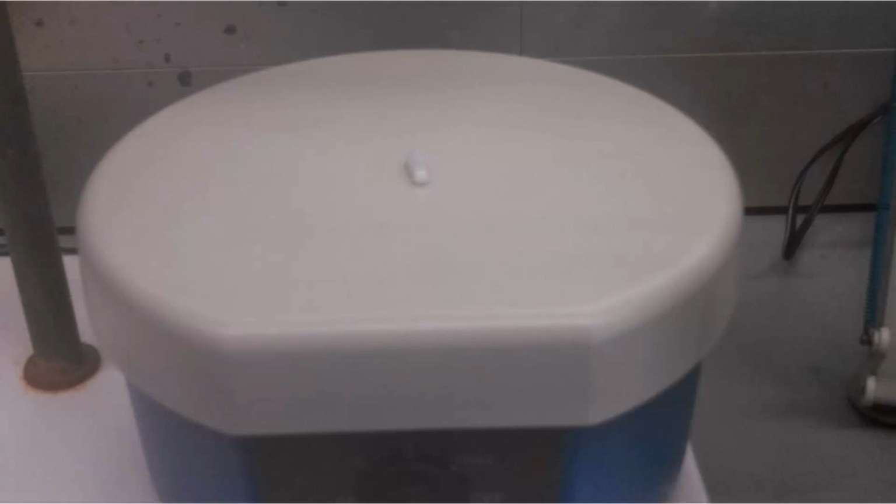Like I said, this stir bar is really tiny. All the waste for this experiment can go down the sink, but it's very important that you don't dump these stir bars down the sink because they are obviously not soluble in water. If you'll notice our sinks, all the drains are on the right-hand side. So you should pour your beakers out on the left-hand side so that if the stir bar does come out, you have time to grab it before it goes down the drain.